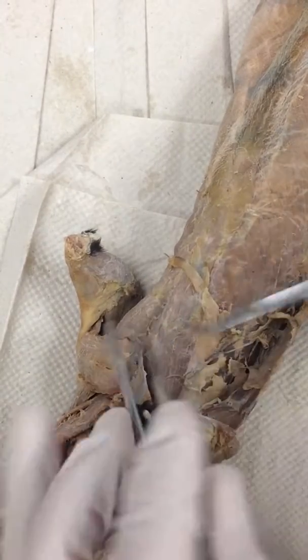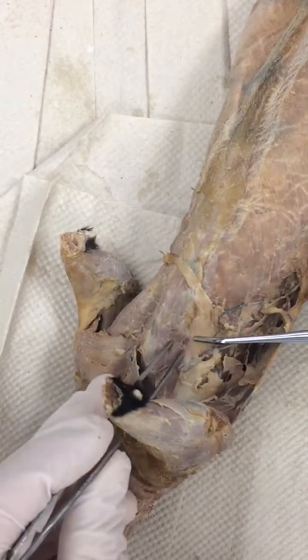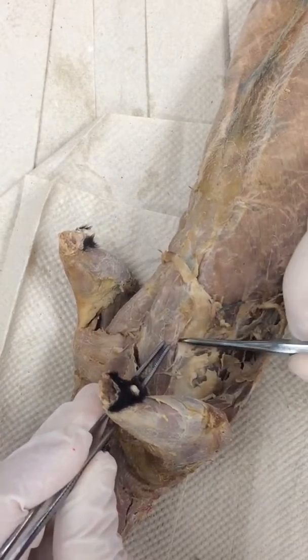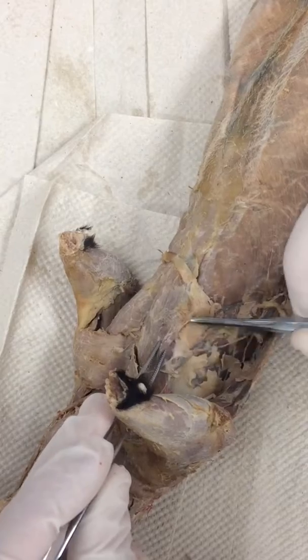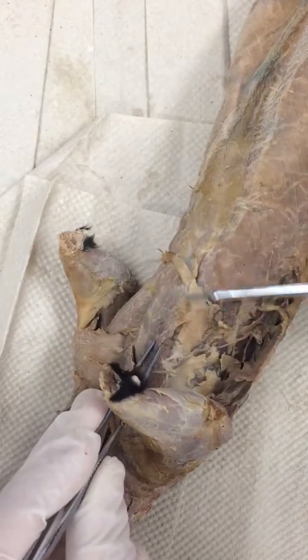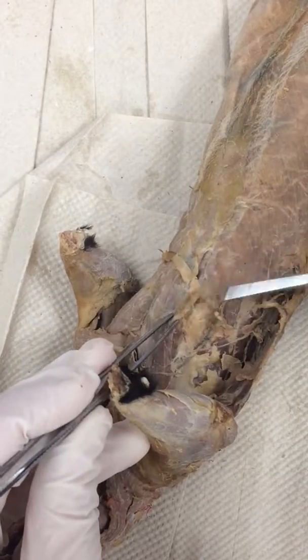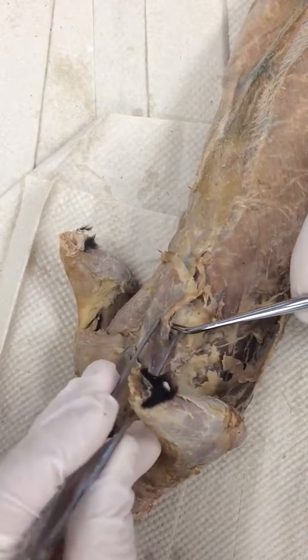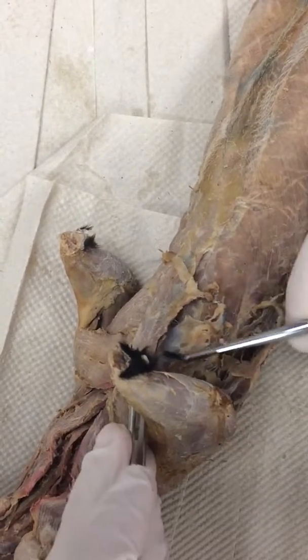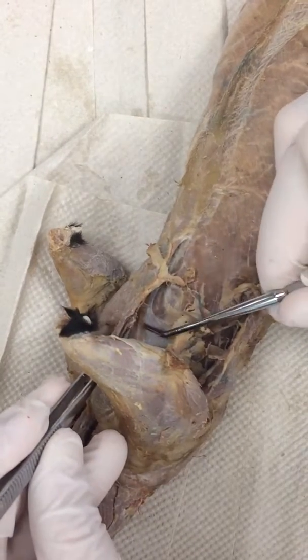Now it's real simple — we just come back and do minor. You can see the lines right here. I'm going to lift this up, sharp side, scrape right on that last fiber — look at this — roll the nose. You can see this is starting to separate into upper and lower bundles; we want to make sure we keep all of that together. I'm going to re-gather all those fibers — so nice. Just push that fat down for now, we'll deal with that later. I found some more fibers down in there — I'm going to lift them up and gather everything together.